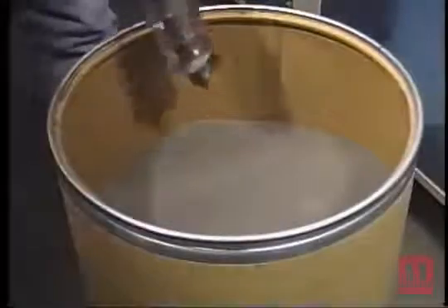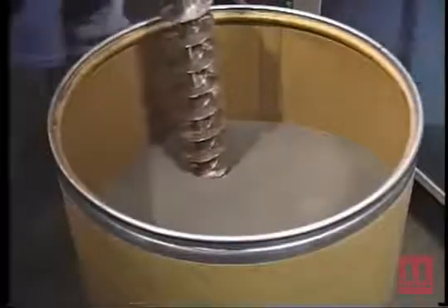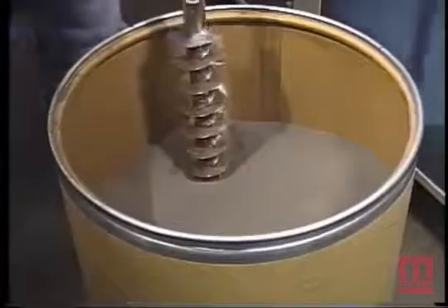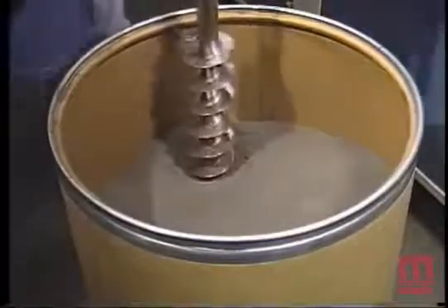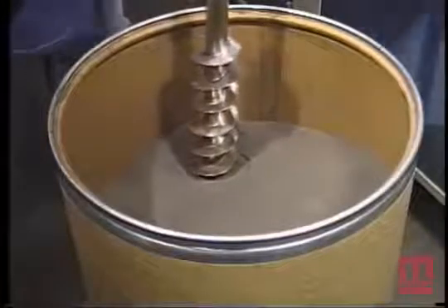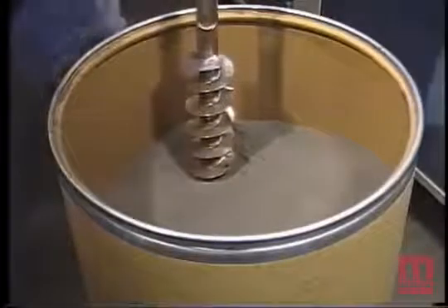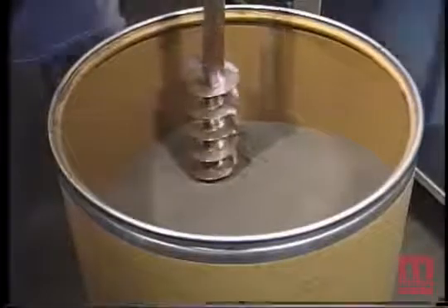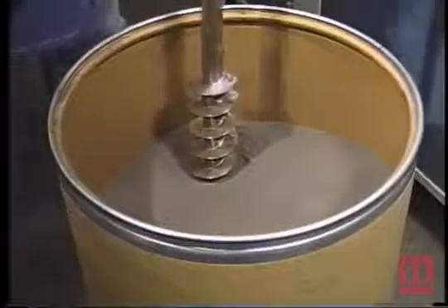The keystone sampler in the closed position shall be inserted into the powder through a point 70% of the distance from the center of the cross section to the periphery, and straight down to the bottom of the container.